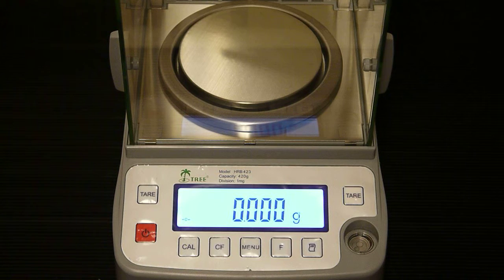To change any settings you have to enter in a menu code. For example, today we are going to change the weighing unit from grams to pounds. So we are going to enter in the menu code 174.